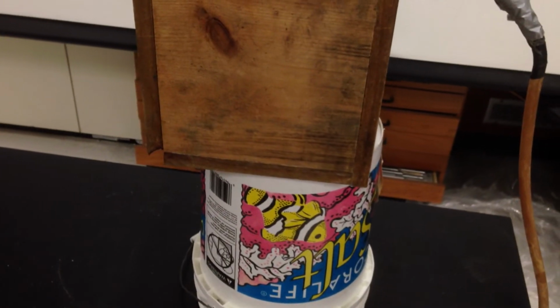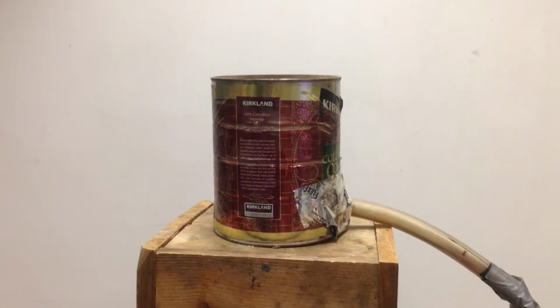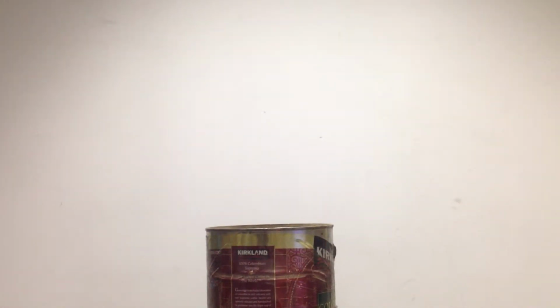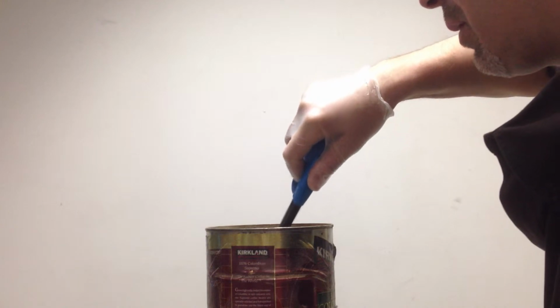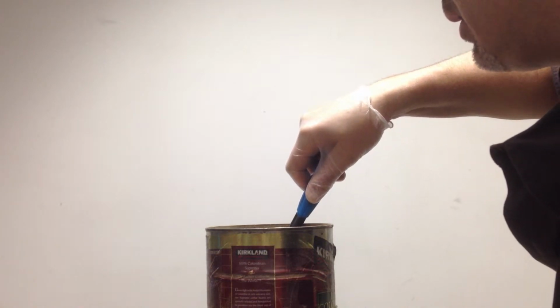So let's do it. So I'm going to light the candle, and again, I'm after something called a grain elevator explosion. So I'm looking to see if I can create somewhat of an explosion upward when I blow through the can. Alright, so let me light the candle. I already have sawdust in that inner compartment that I showed you. Of course, I have to have a lighter that works. Okay, so my candle is lit.